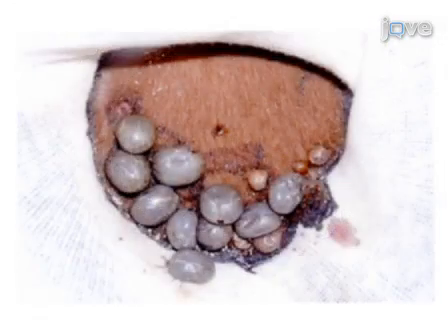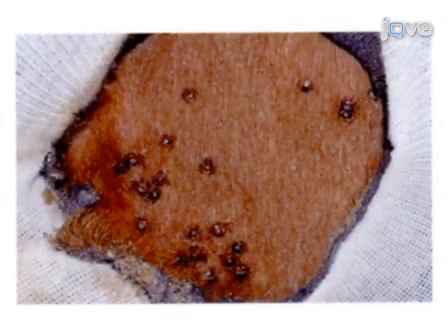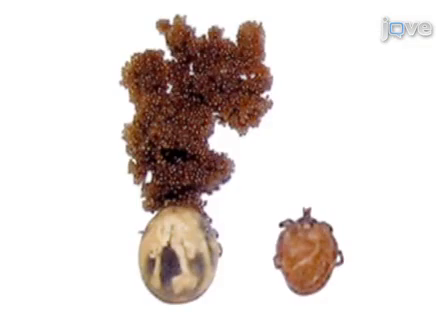Finally, tick feeding parameters, such as weight, molting, and oviposition, and the expression of the target gene or genes of interest by real-time RT-PCR are determined. Ultimately, results can be obtained that demonstrate the effect of silencing targeted genes on tick biology by evaluation of tick biological parameters and gene expression by real-time RT-PCR.